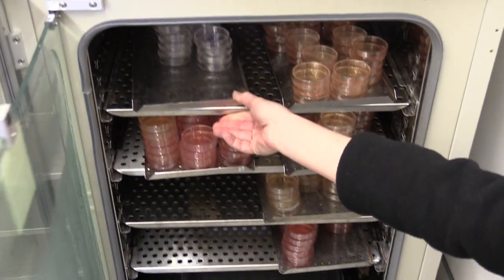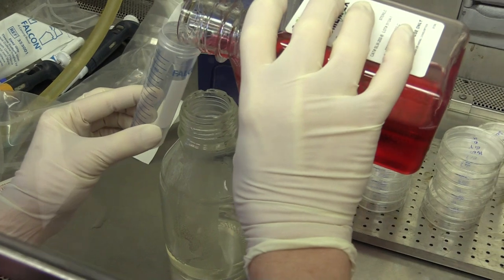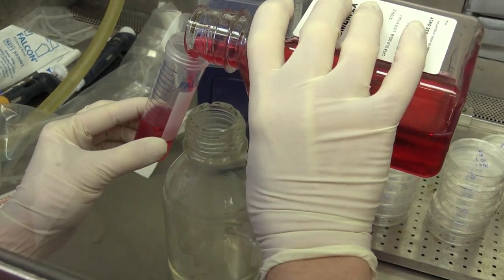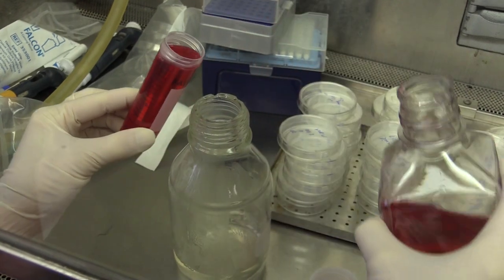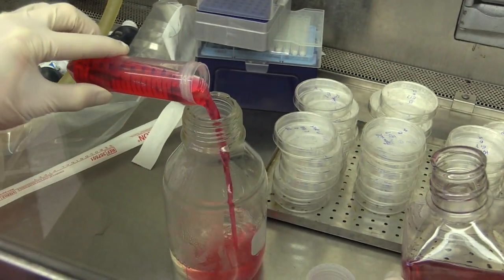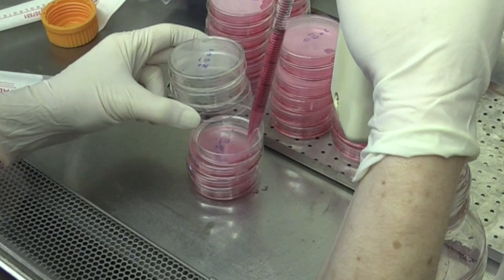When the virus adsorption time is over, we mix the agar solution with our cell culture medium, which has also been warming up at 45 degrees Celsius. We then add this mixture to each cell culture well.